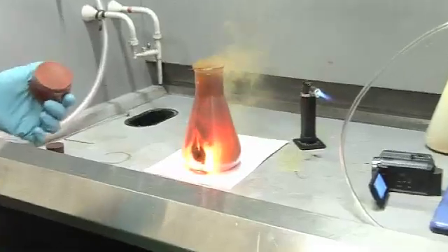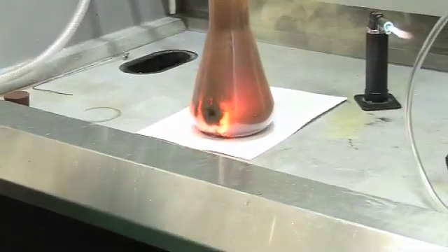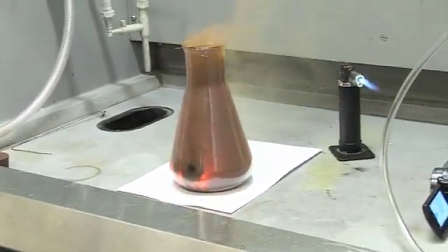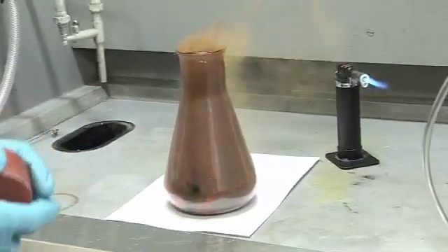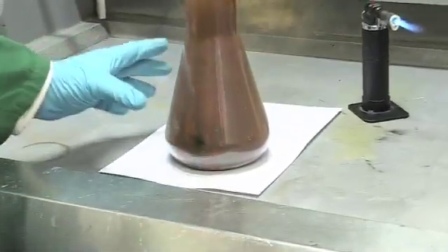So really rapid reaction there as the hot iron starts to react with the chlorine to form iron chloride. Very, very exothermic again. And I think yes, this is very hot. We might have to move it off the paper.